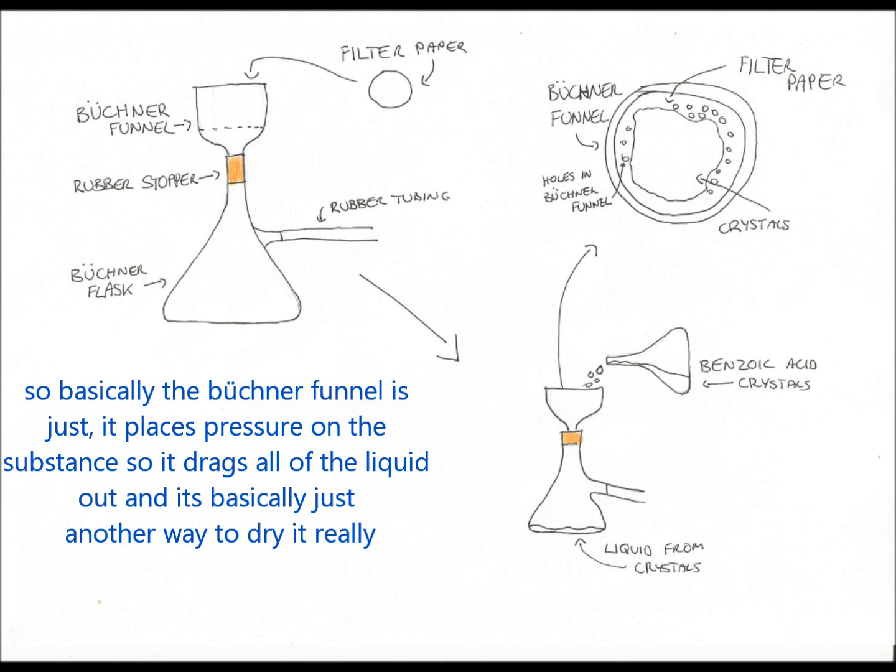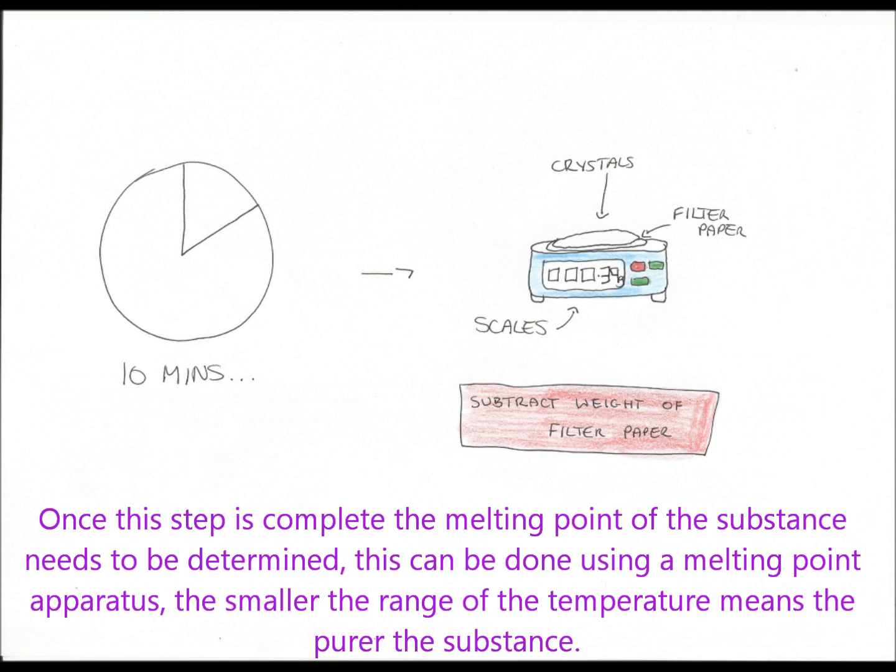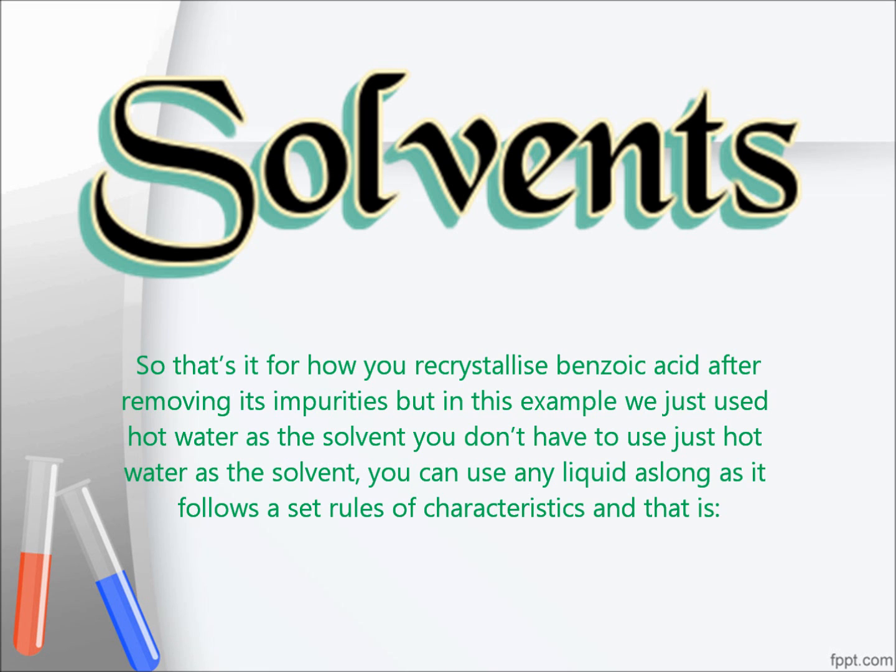Basically, the Buchner funnel places pressure on the substance so it drags all of the liquid out, and it's just another way to dry it. Once this step is complete, the melting point of the substance needs to be determined. This can be done using a melting point apparatus. The smaller the range of temperature, the purer the substance. So that's it for how you recrystallize benzoic acid after removing its impurities.